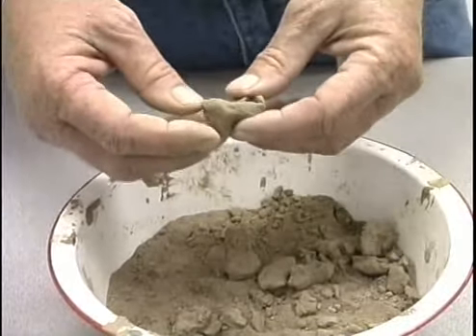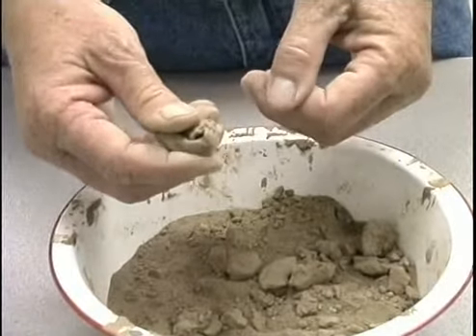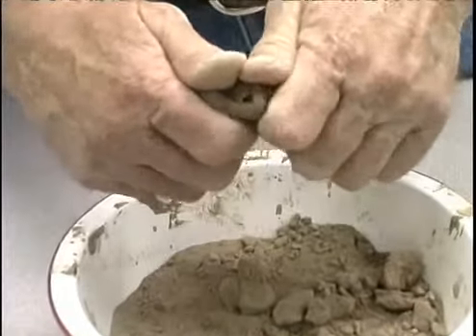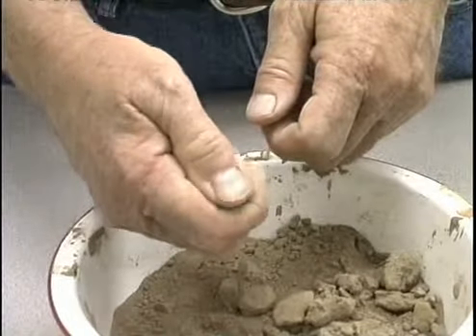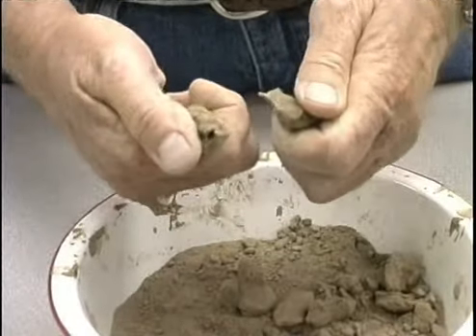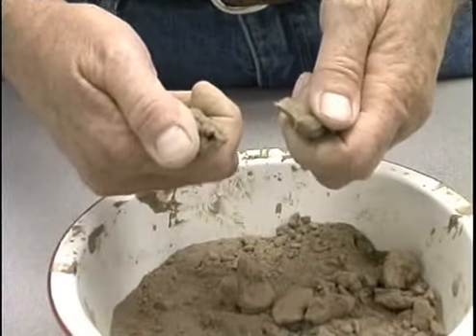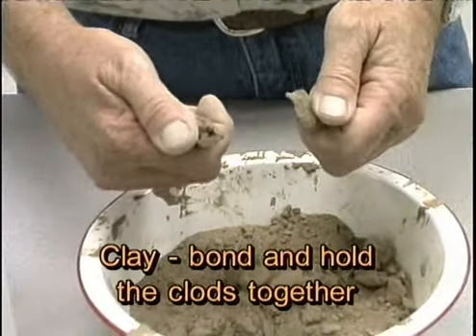Now you noticed in the last one, when I got ready to exert a force on that particular PED or soil structural unit, that it broke rather easily. Now in this particular case, if I take this one and exert the same force, no matter how much force I exert, I cannot get this particular one to break. Matter of fact, this one you have to use both hands and push on it really hard to get it to break. So this is an indication to me that this particular soil has a much higher clay content, because clay is kind of the binder in this soil which helps hold these aggregates or clods together.